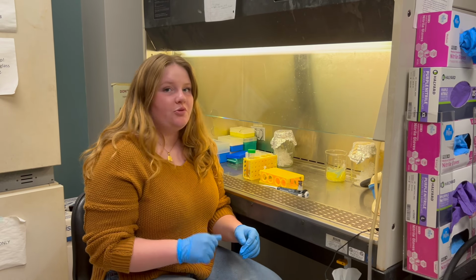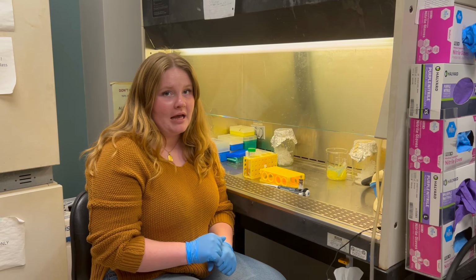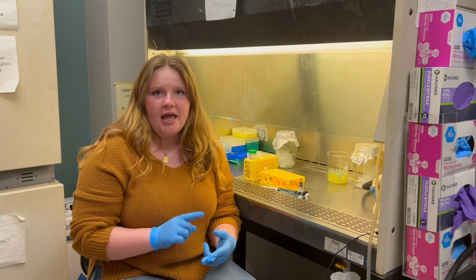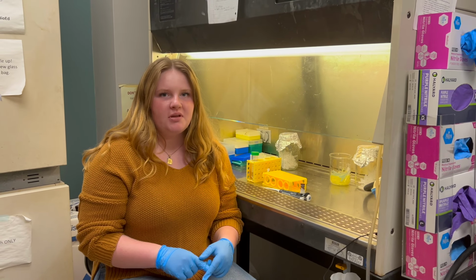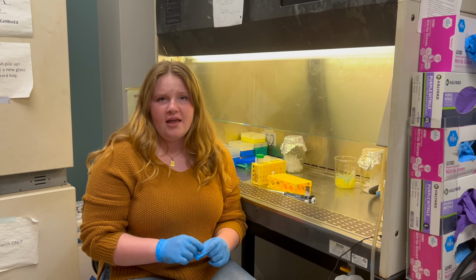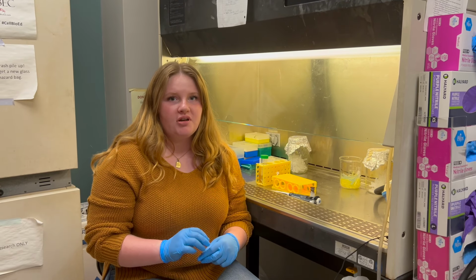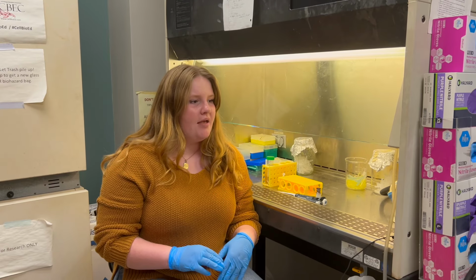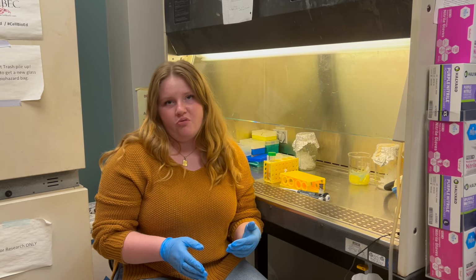Hi guys, my name is Brie and I'm going to be showing you how to make your AOPI stock solution. So how much you need to make depends on how many wells you're doing and how much you want to put in each well. So we did 20 microliters per well and 24 wells. So that's 480 microliters total of our stock solution. And we're going to make a little bit extra just so we don't run out.